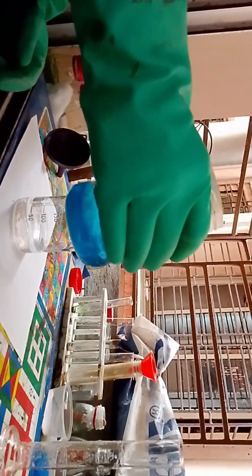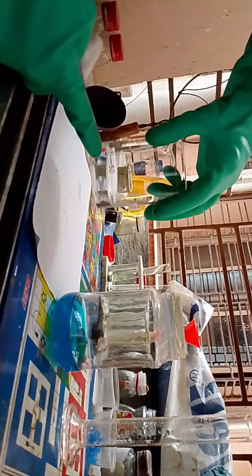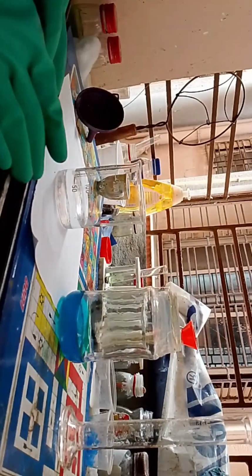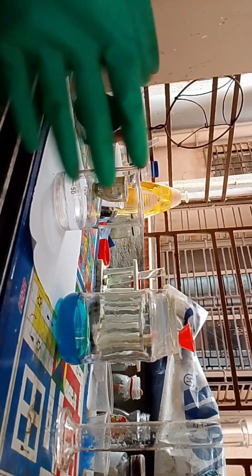the reaction will continue. Okay, this is the 50 ml of copper sulfate solution we prepared. Now I'm going to pour it in, and when I pour it in, you will see a sky blue precipitate of copper oxalate, and the solution, which is at this moment clear and here too clear, will turn immediately upon contact very unclear, and it will become a colloid solution.